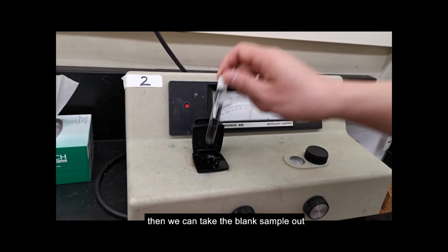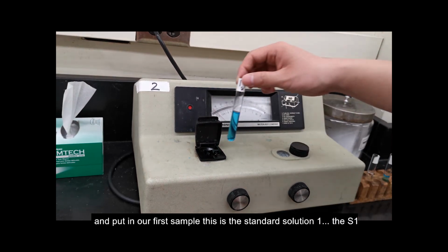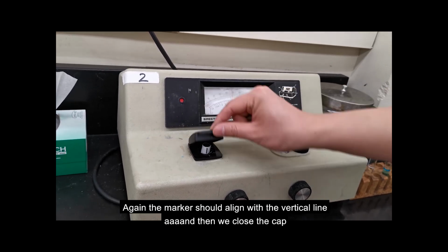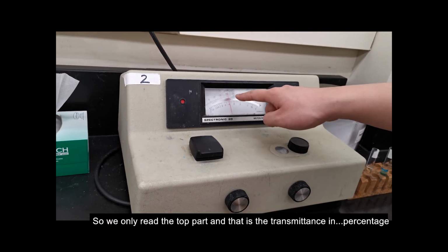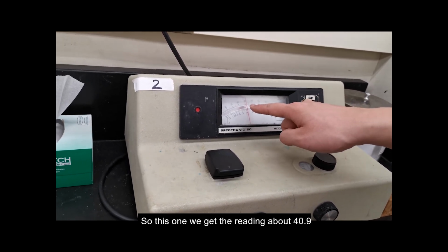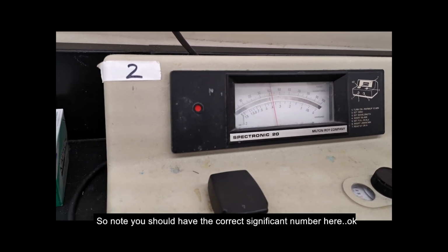Then we can take the blank sample out and put in our first sample. This is the standard solution 1, S1. Again, the marker should align with the vertical line. And we close the cap. And then we have the reading. We only read the top part, and that is the transmittance in percentage. This one we get the reading about 40.9. Note you should have the correct significant figures here.